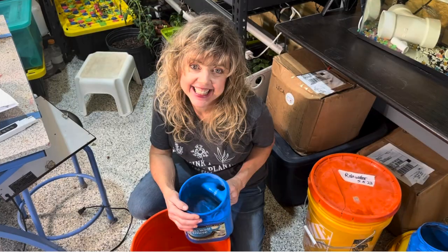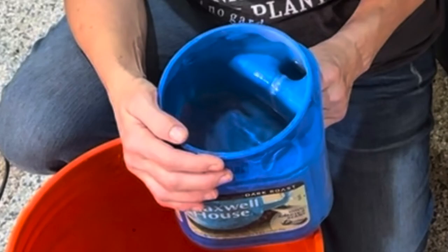Time to engage two tools: the EC meter and the pH balance kit. Time to save the plants. After measuring EC and pH, I realized I needed to add more pH balanced water to the nutrient solution.